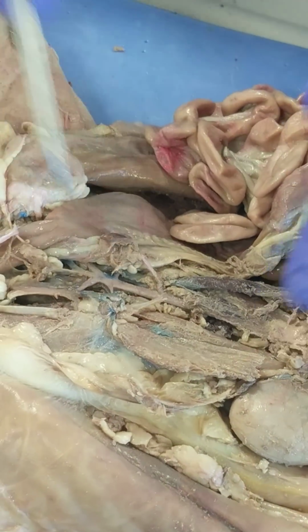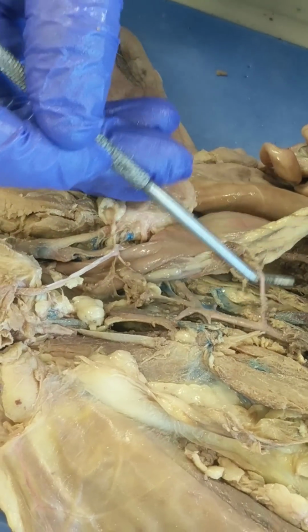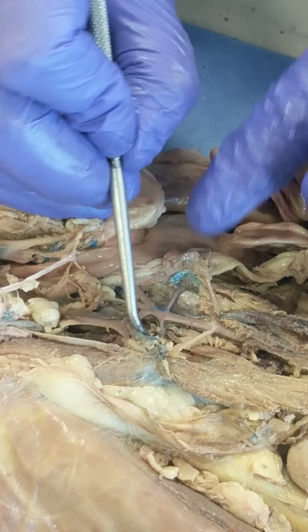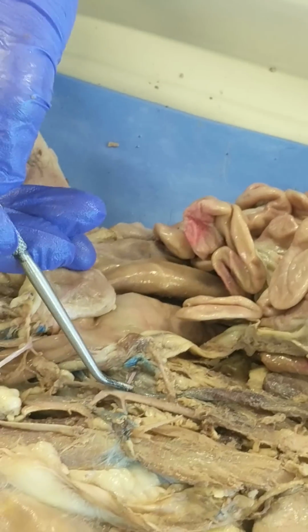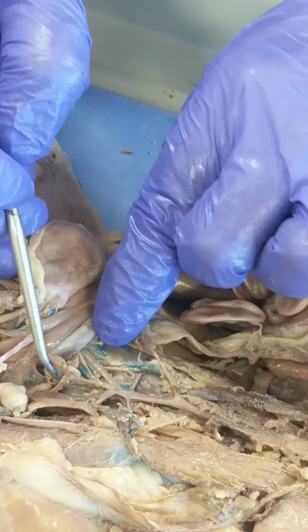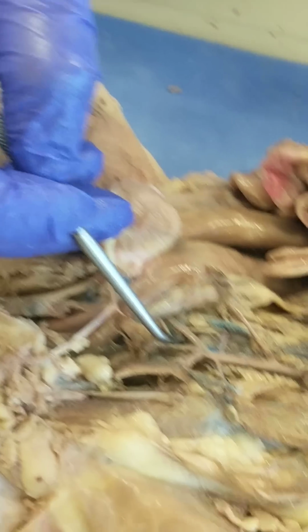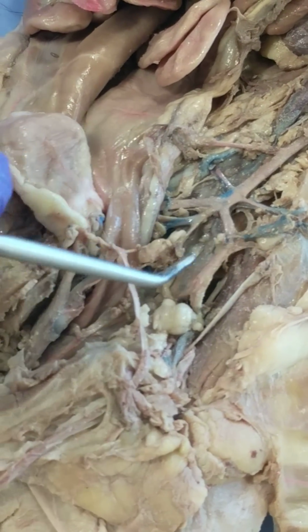If we go more posterior or down the length of the abdominal cavity, again, here's the inferior mesenteric, and right after the inferior mesenteric artery are two arteries that are very perpendicular to the aorta. Those are called iliolumbar arteries, left and right. And then the aorta kind of bifurcates. It does so twice, actually. Here is an external iliac artery. Here's the other external iliac artery. So right external iliac, left external iliac.